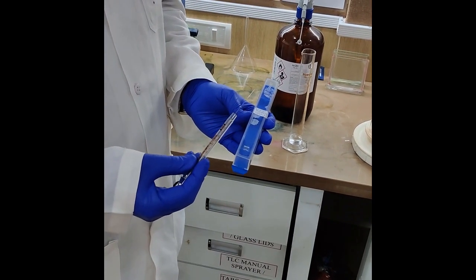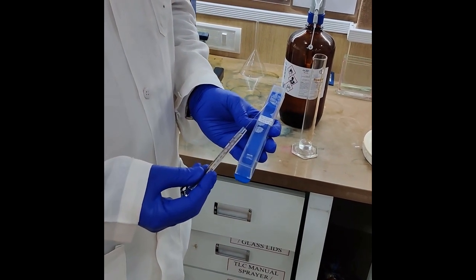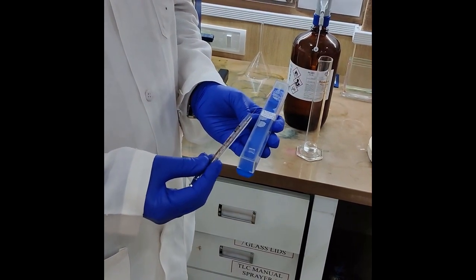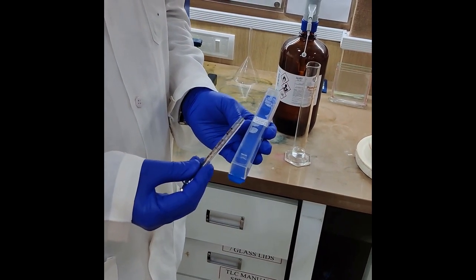Hello and welcome to another video by Ancrom. Today we are going to learn how to solve a very commonly occurring problem during a routine HPTLC analysis—that is a syringe block.